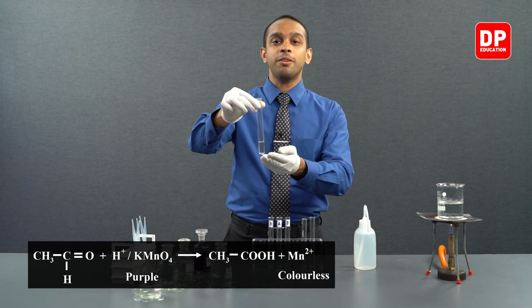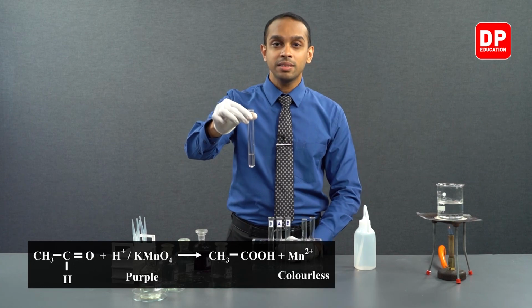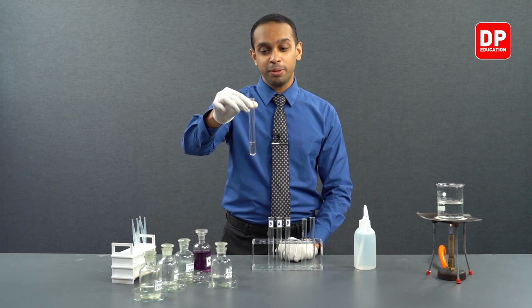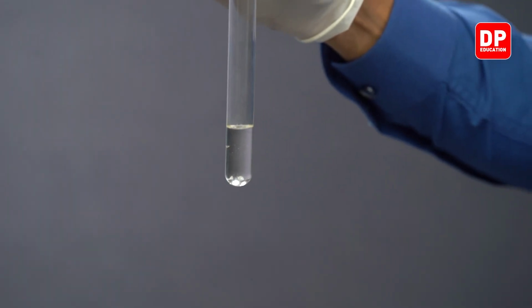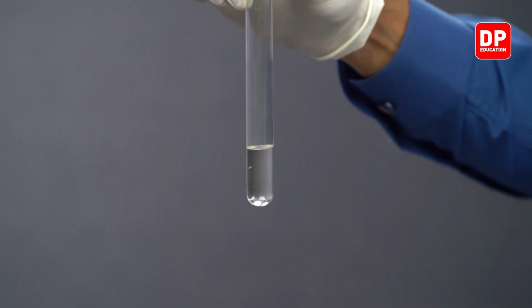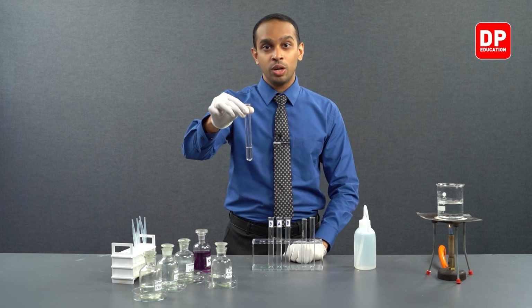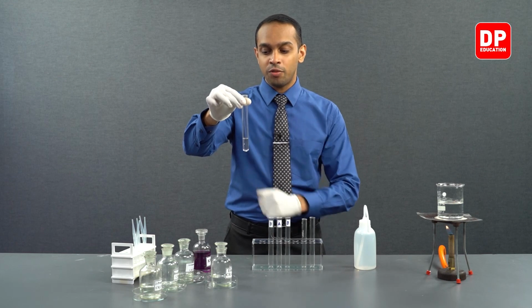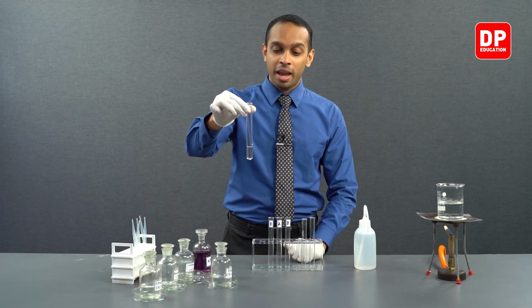So, in the presence of ethanal or acetaldehyde, you can see acidified potassium permanganate got decolorized. What happened there? Since acidified potassium permanganate is a good oxidizing agent, the acetaldehyde that we used, or ethanal that we used, got oxidized to ethanoic acid. Now let's move on to our aliphatic ketone.